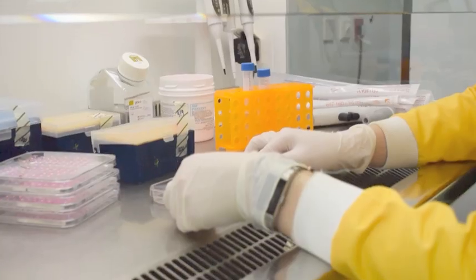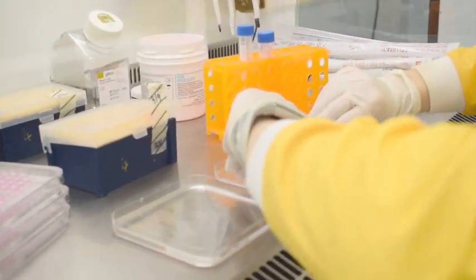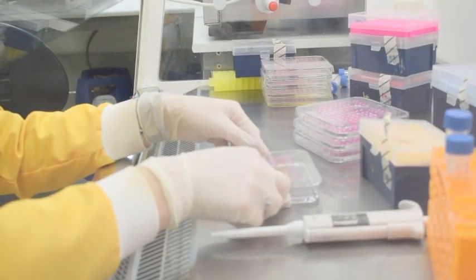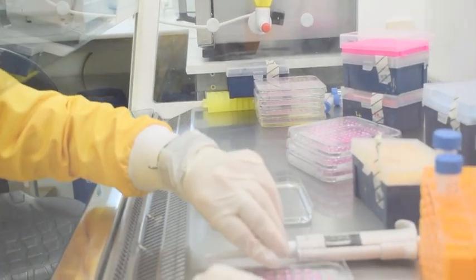On the third day post seeding, plates are removed from the incubator, flipped, and 6 µl of fresh cell culture medium added to each individual spheroid hanging drop using a multi-channel pipette.